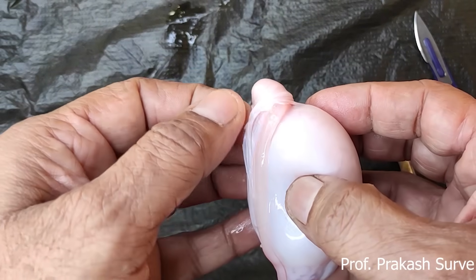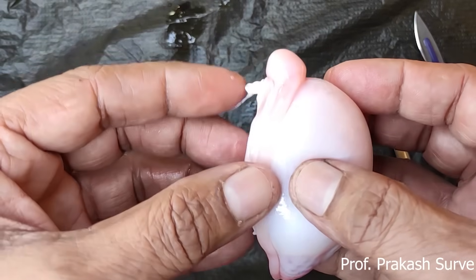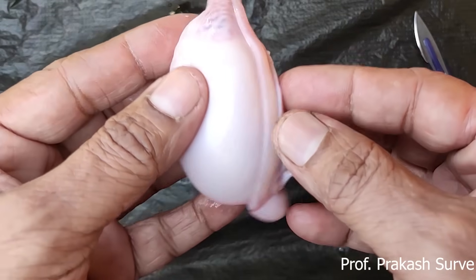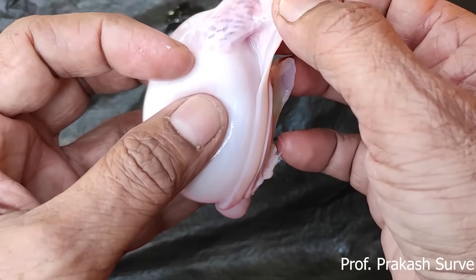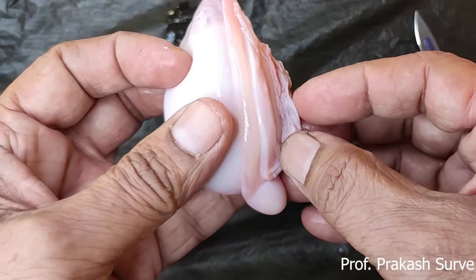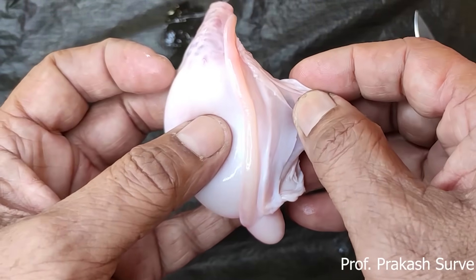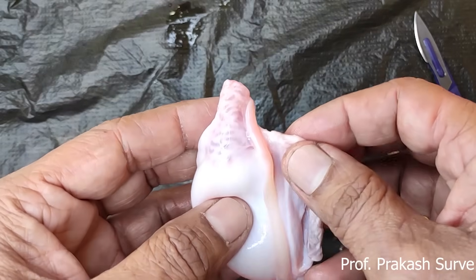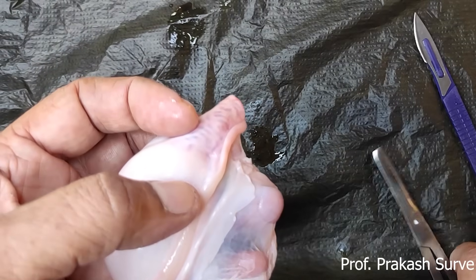What is inner to this? That is about the tunica vasculosa. The tunica vasculosa is a thin membranous and vascular layer. First I will remove this layer of tunica albuginea.